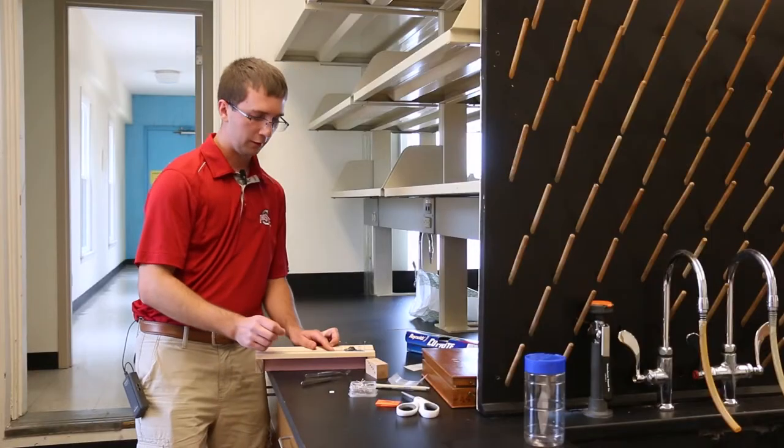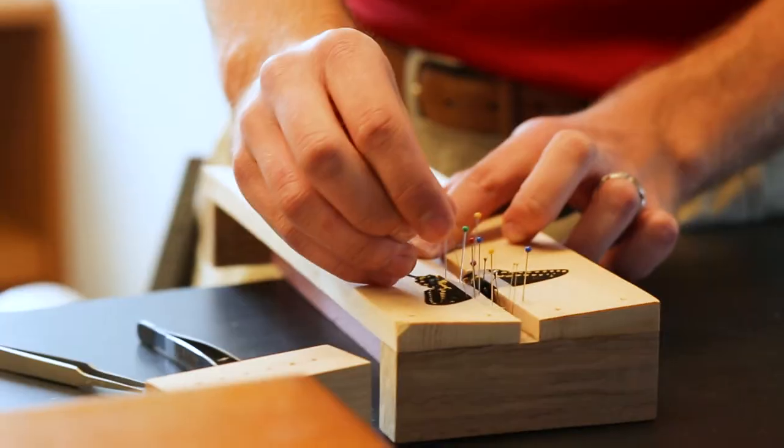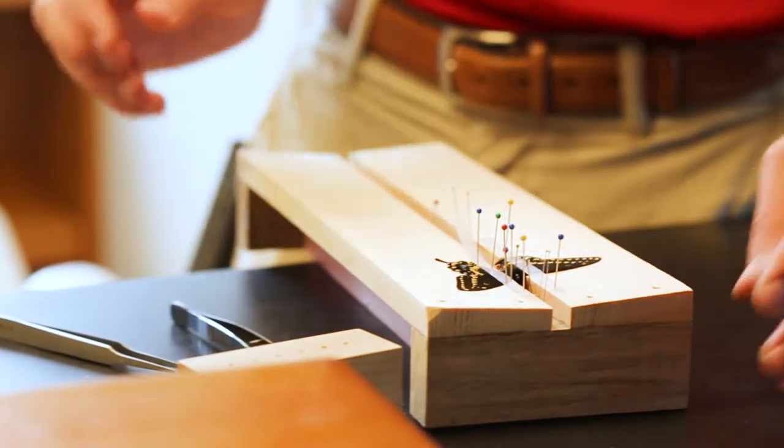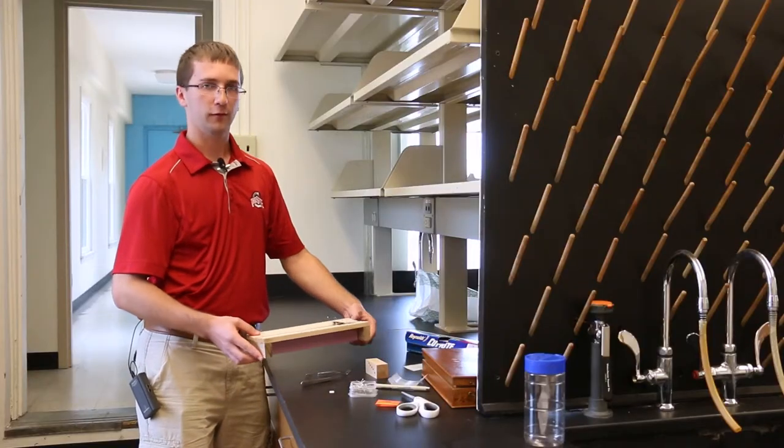So now that I've got it pinned, I can remove these smaller pins from the wings and it should hold in place. Now I'm going to flip this around and do the other side.